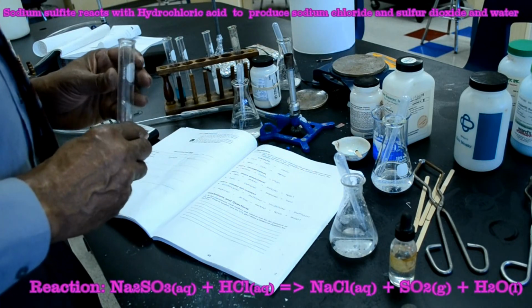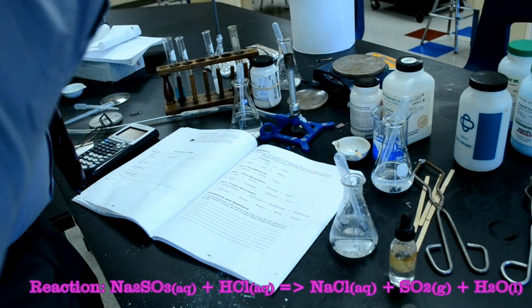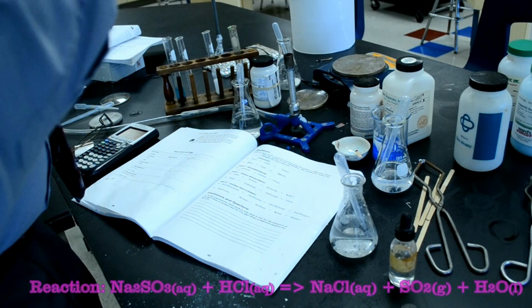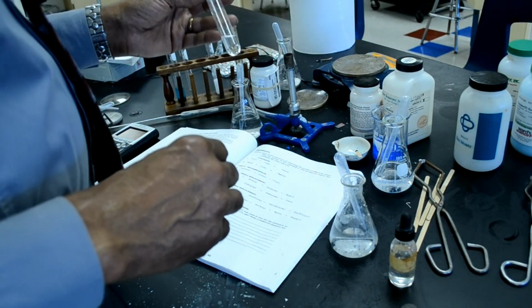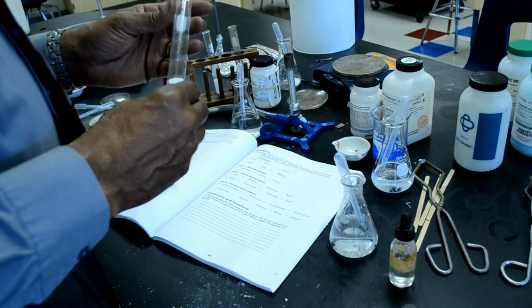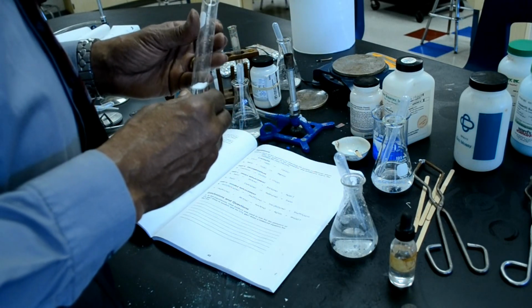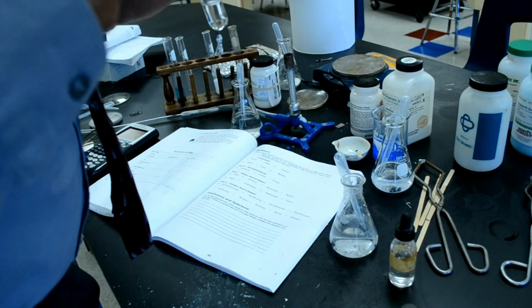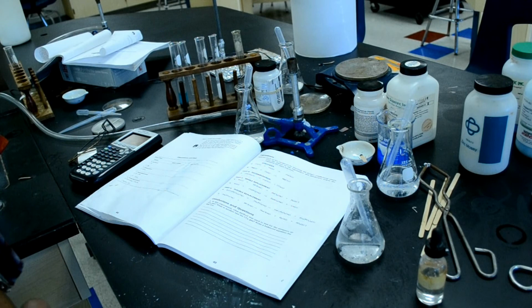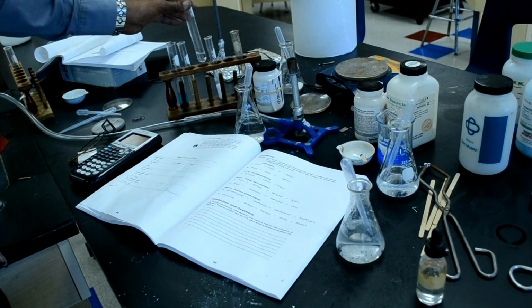Then it says, note the odor given off by wafting some of the gas towards your nose. And I smell the odor of burnt sulfur coming from the test tube. So this is probably the odor of sulfur dioxide. Now we have to go to the observations and data. Oh, by the way, this was also a double replacement reaction.